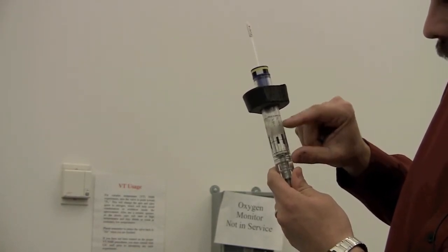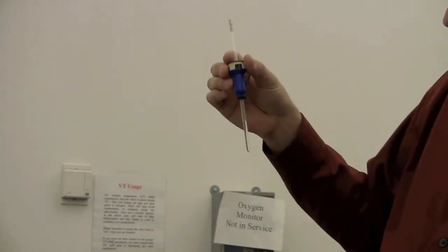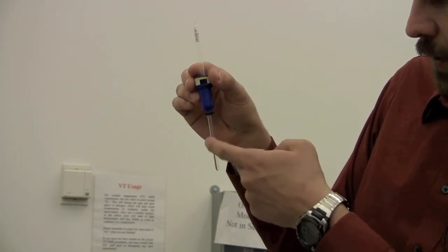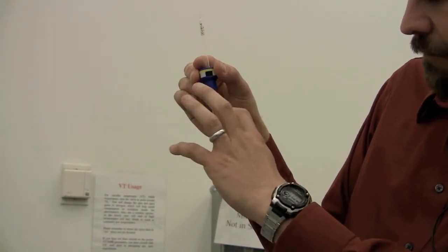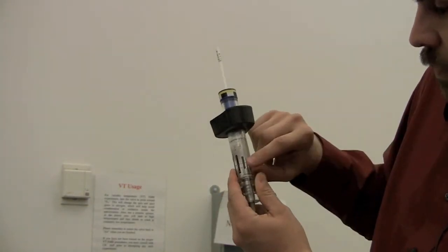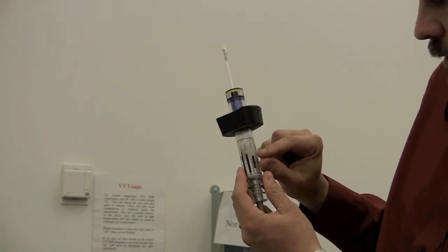Now you might say, well, then I don't need the remaining parts of the sample. The reason you need the remaining parts of the sample extending above and below is that when you put the sample into the magnetic field, the sample itself distorts the magnetic field. That distortion is fairly uniform in the middle, but it curves around kind of like a bar magnet on the ends. We need the ends to be far away from the part that we're observing, so that's why the sample needs to be taller than the part that we're observing. Now, because we're only observing this part, if you made your sample really tall, you're not going to get any more signal than if it's a reasonable height. So there's no point in having too tall of a sample either.